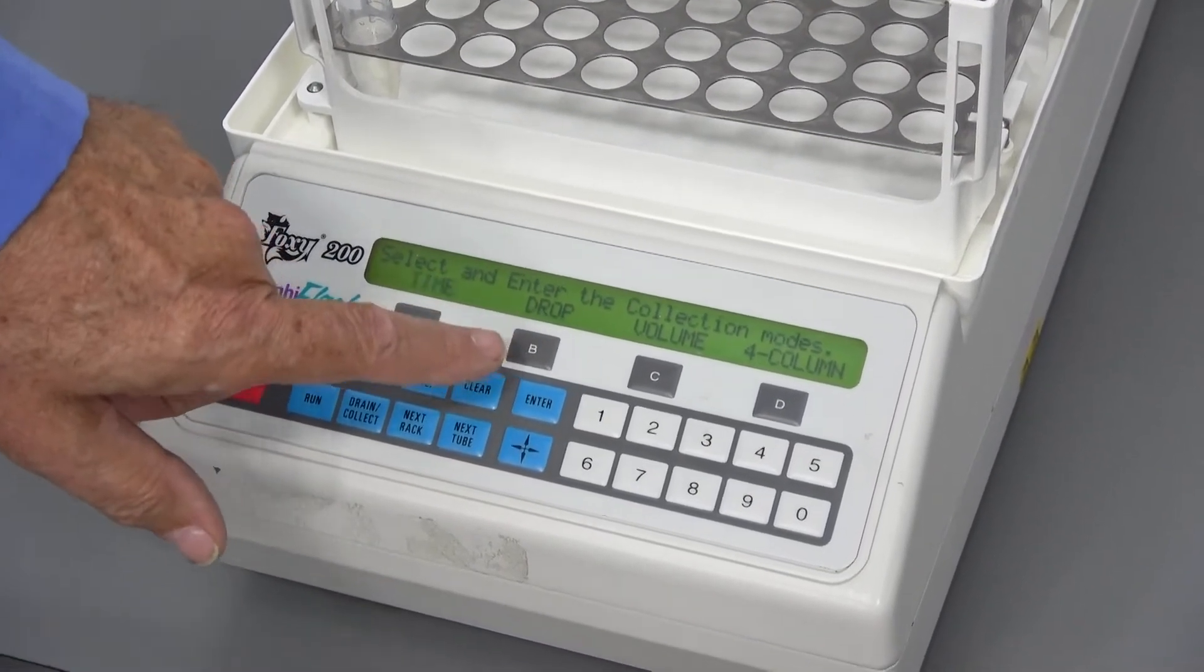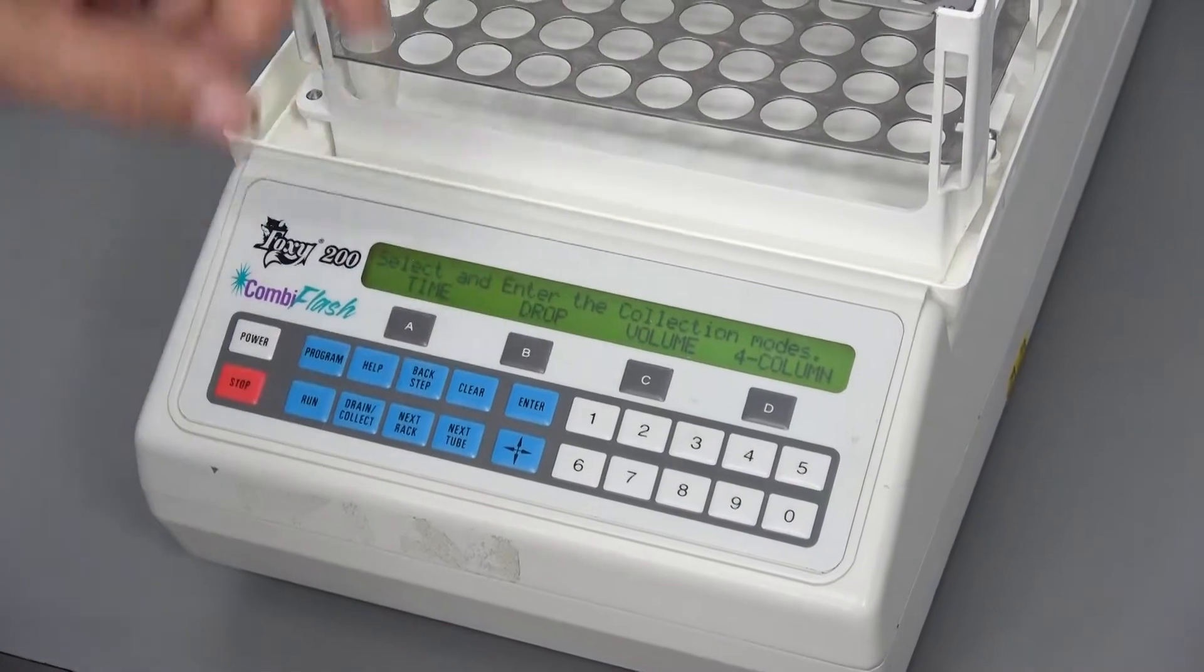We're going to select time, although we could select it to have it count drops or by the amount of volume.